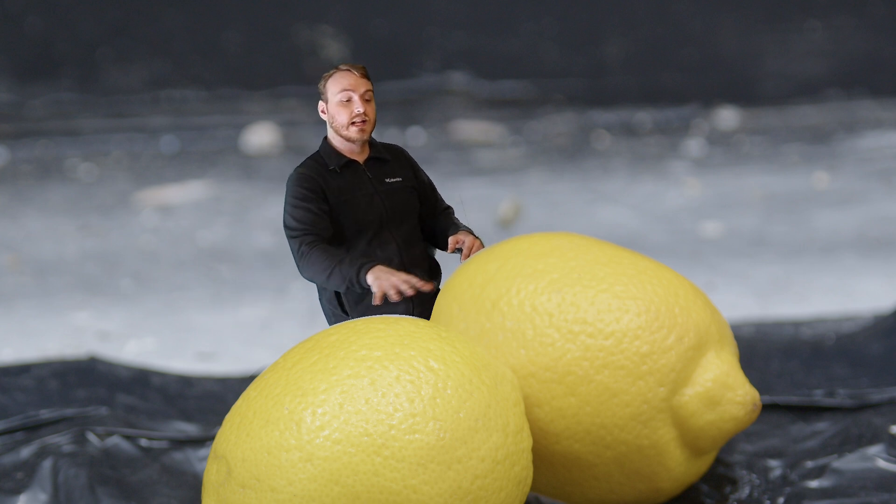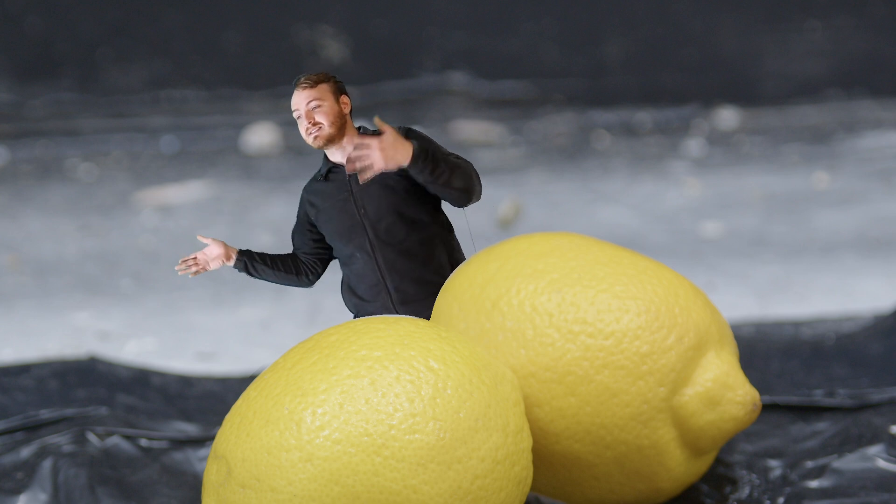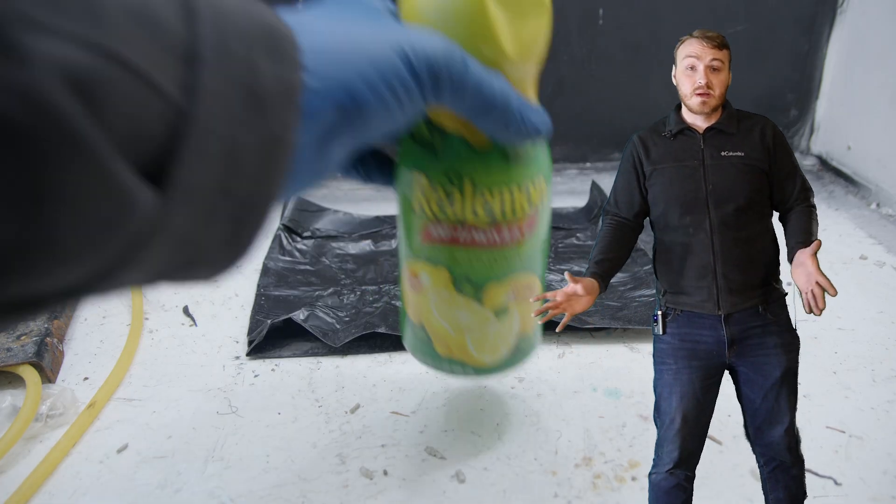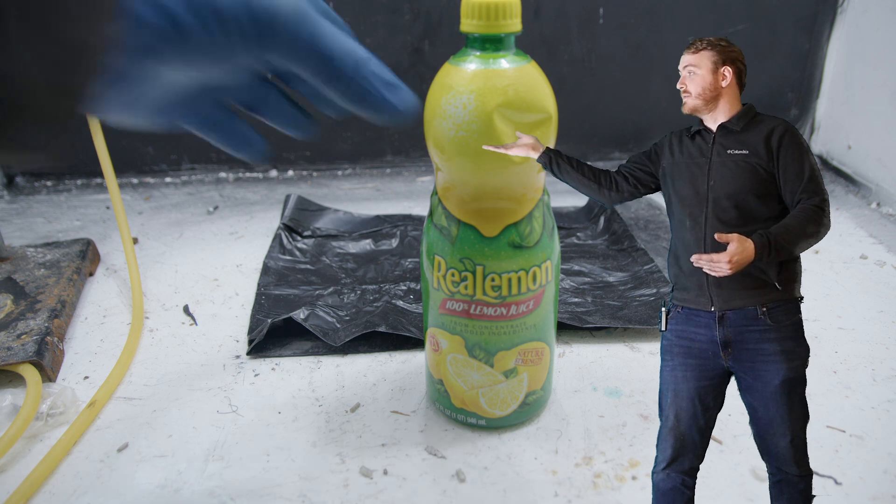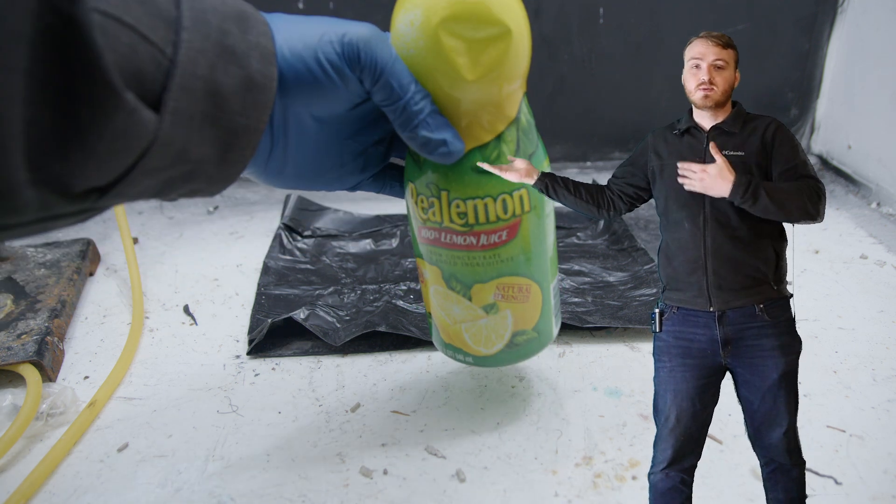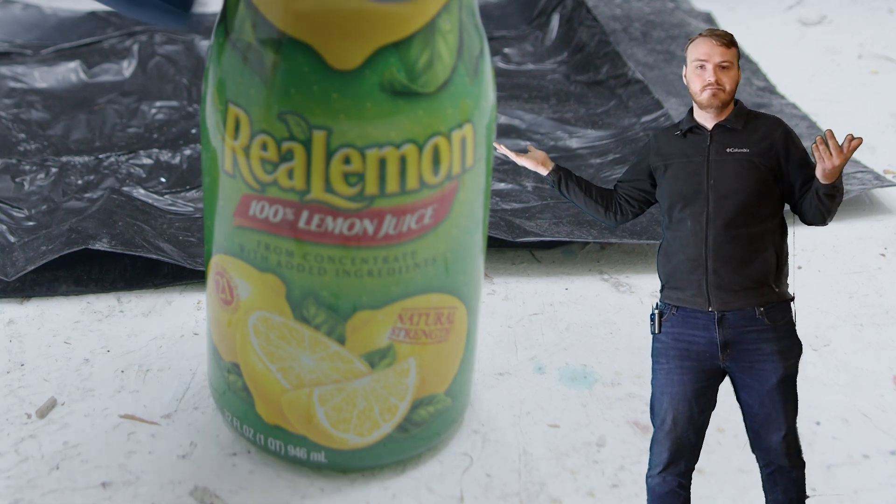We're going to use these little lemons here, but I'm not going to be using entirely lemons. I'm just going to buy some lemon juice. Don't be upset. I didn't want to buy lemons and have to squeeze a bunch of lemons. It's real juice, real lemon juice. It says right on the bottle, real lemon, real lemon juice. They wouldn't lie.